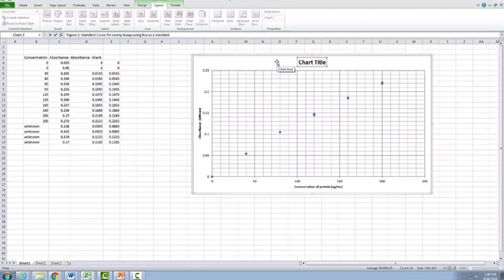Now, you guys can use whatever title you would like. You just need to make sure that it includes the assay that you're actually completing and potentially some information about what you're trying to measure off that standard curve. So whether it be that you discuss what actual protein you've used as the standard, or you actually discuss what the unknown is itself that you're trying to determine. So you can see here we have quite a large title added to the top here.